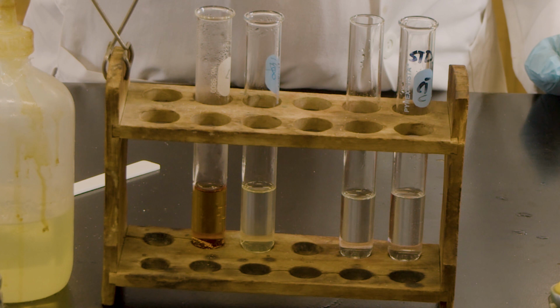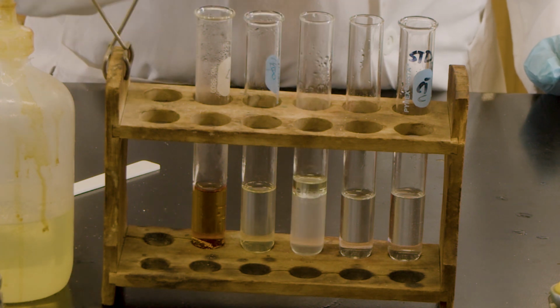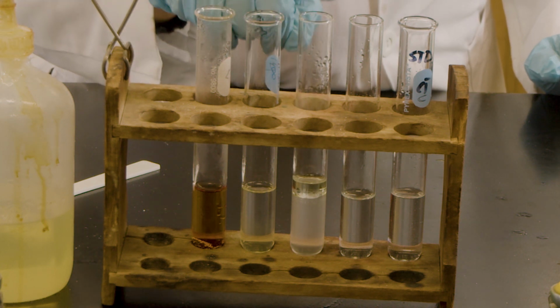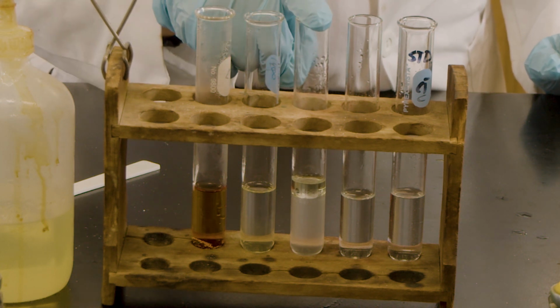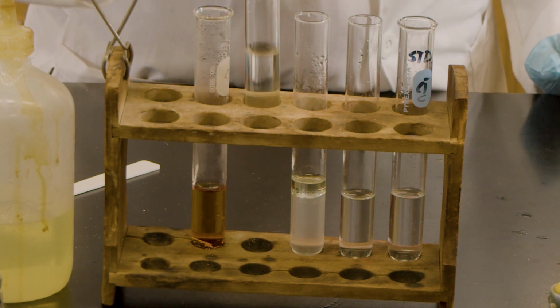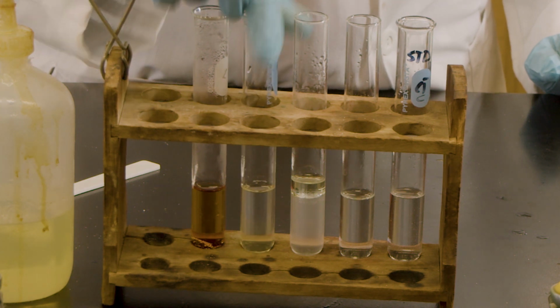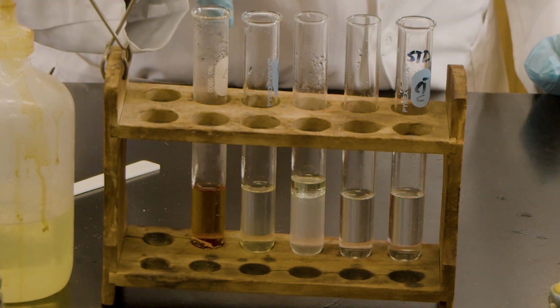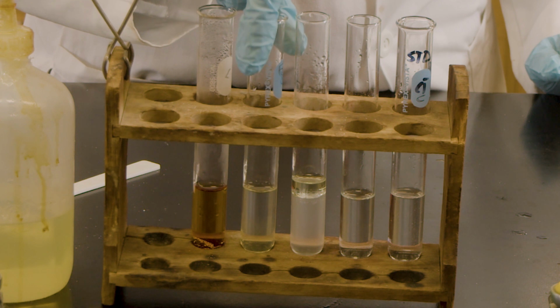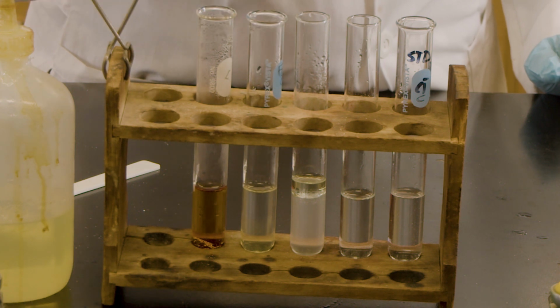This is for the oil and water. You can see still the layer. So in the cold water, you could see the layer. When you do the hot bath, it still has a layer. The gelatin was not totally soluble in a cold bath, but when we do the hot bath, then it was soluble. As the temperature increases, the solubility increases.